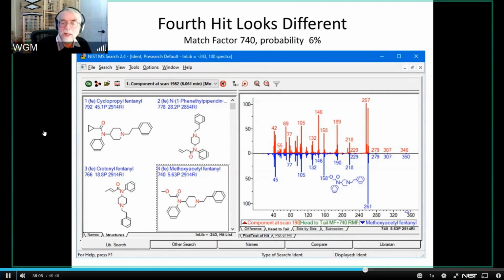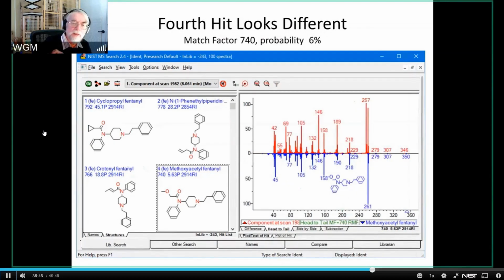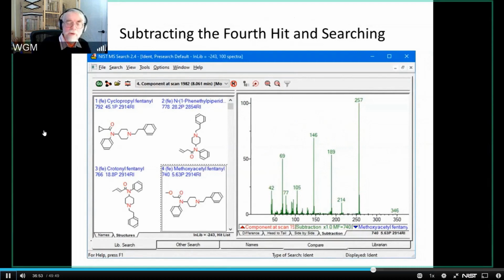We're missing the highest intense mass peak, and in one of the cases we're missing the next highest. And so the suspicion is that there's some sort of a mixture being analyzed here that's not being separated by the chromatography. And so to do that, we say, well, let's start. In this case, we're going to start in the reverse direction. We're going to start by subtracting the fourth peak. That is to say, we're going to subtract the thing that has the 261. Remember that the 261 is present in the methoxyacetylfentanyl. So I'm going to subtract it, and then this is the spectrum that I get from that subtraction.